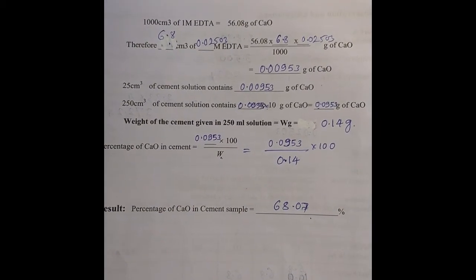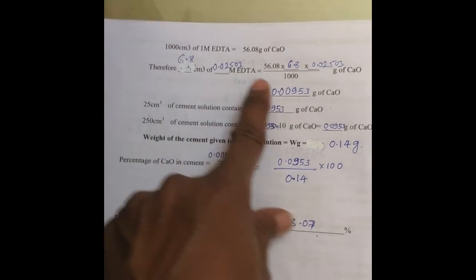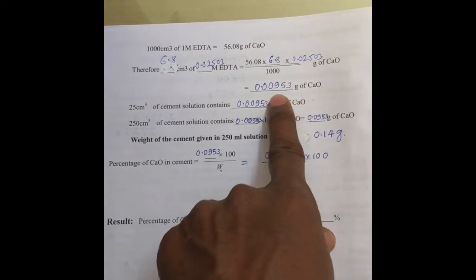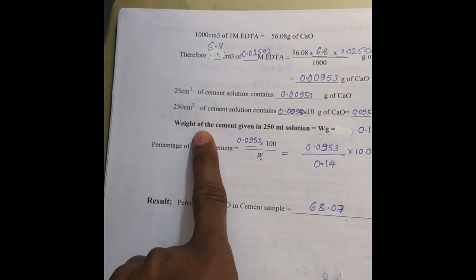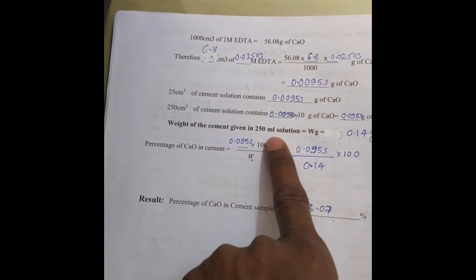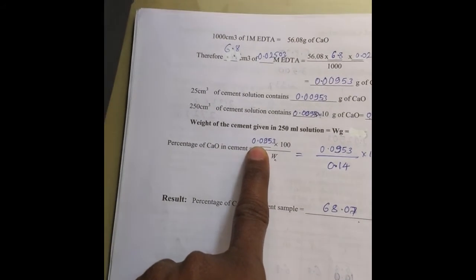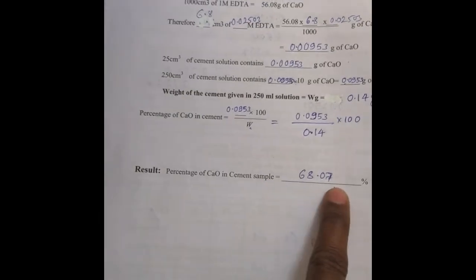We got a concordant value of 6.8 ml. For further calculation: 1000 cm³ of 1 molar EDTA is equal to 56.08 grams of calcium oxide — that is the molecular weight of calcium oxide. So 6.8 ml of this molar EDTA contains: 56 multiplied by 6.8 and molarity, divided by 1000. That gives grams of calcium oxide in 25 ml. Therefore 250 ml contains that amount multiplied by 10. The weight of cement dissolved into 250 ml is 0.14 grams. We calculate the percentage of calcium oxide by dividing the weight of calcium oxide present by the weight of cement taken, multiplied by 100. This gives 68.07% as the amount of calcium oxide present in the given cement sample.